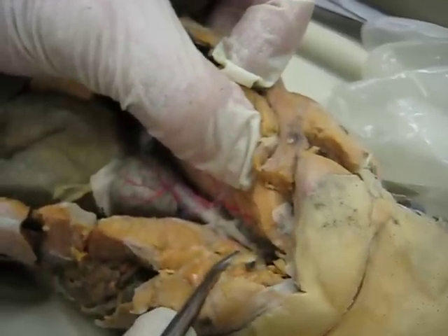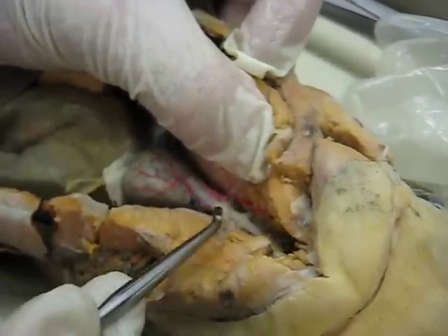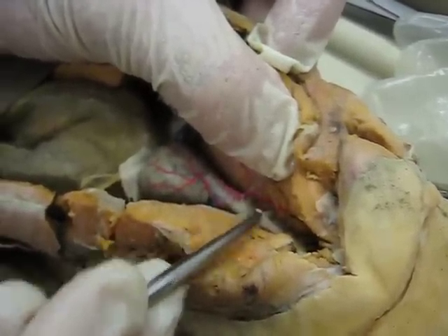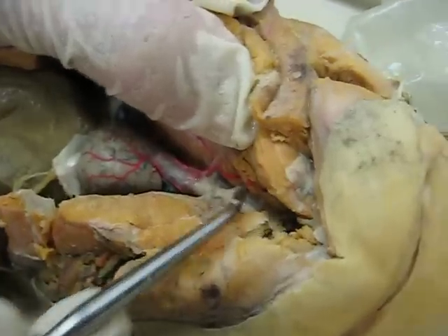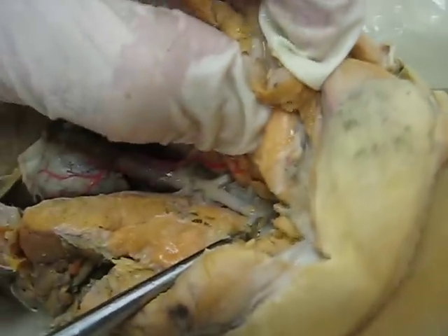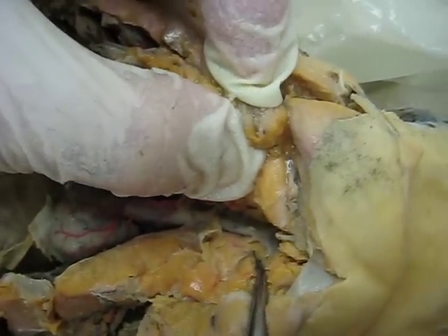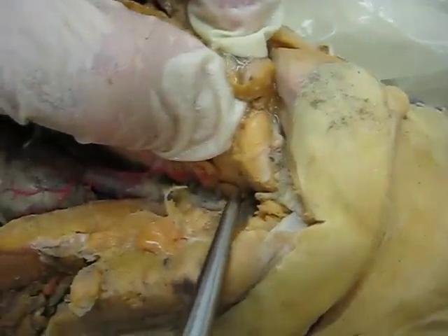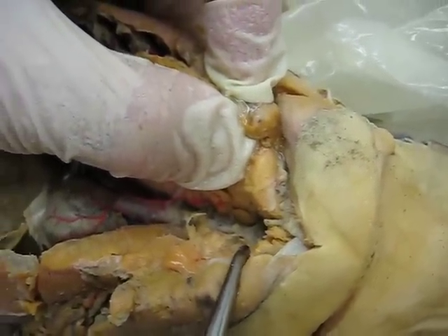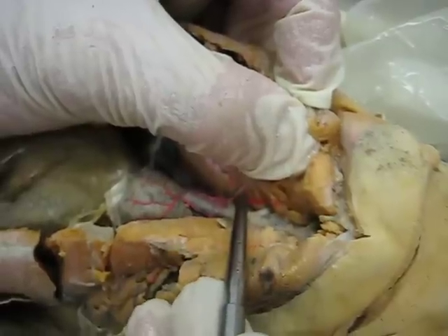There are various afferent branchial arteries that take unoxygenated blood from the ventral aorta to the gills. Arteries 4 and 5 are back here and not very visible; 3 is very visible right there. The ventral aorta comes up and makes a T, with one branch going to each side, and afferent branchial arteries 1 and 2 come off the T on each side. So 1 and 2, then 3 is the really obvious one, and 4 and 5 back here — that blood goes out to the gills.